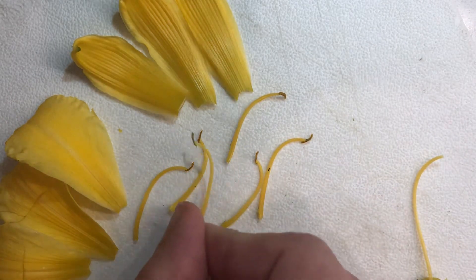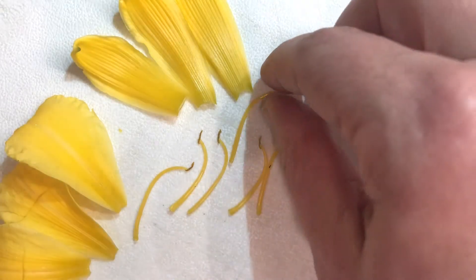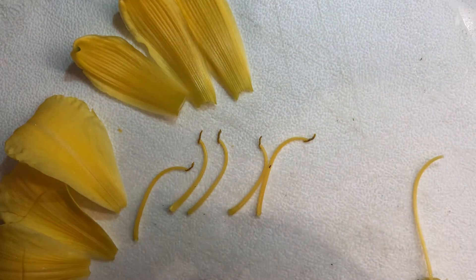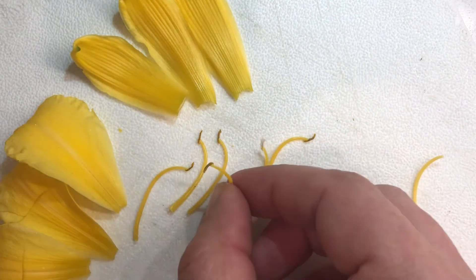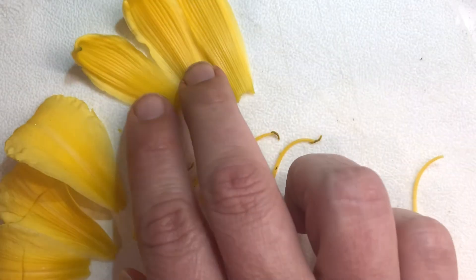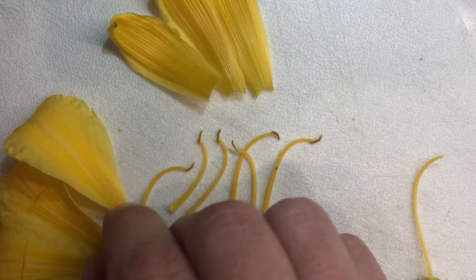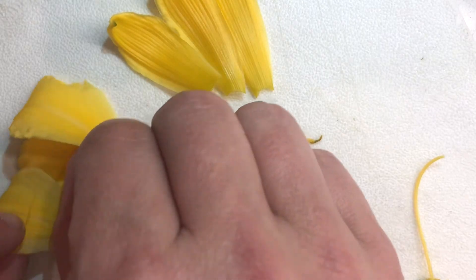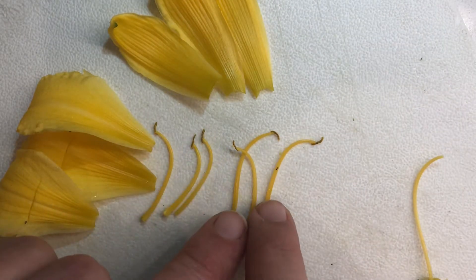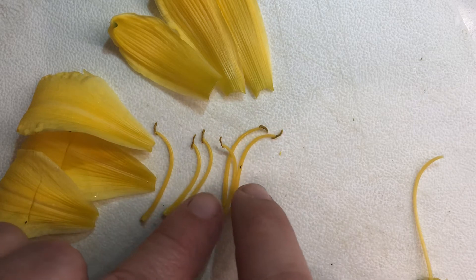This flower had six anthers. You're going to start seeing that there's a pattern here — we had three sepals, we had three petals, and we have a multiple of three: six filaments and anthers.